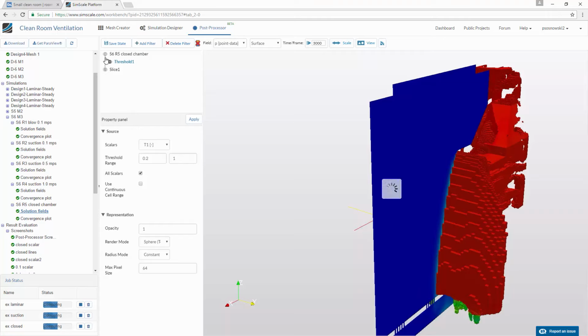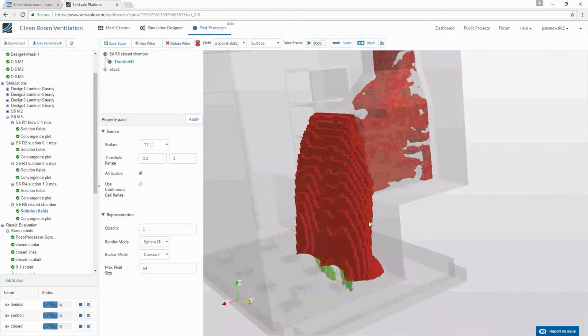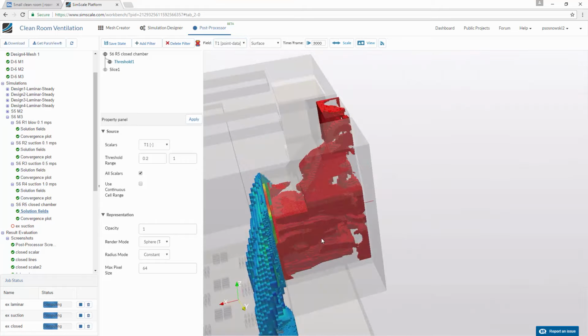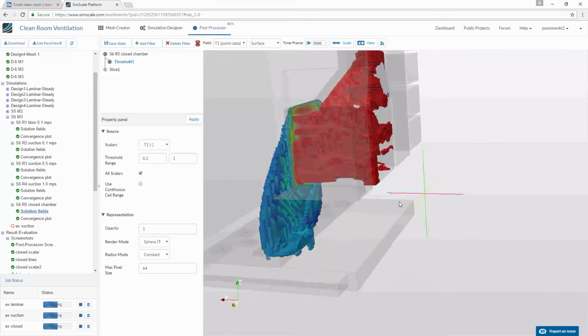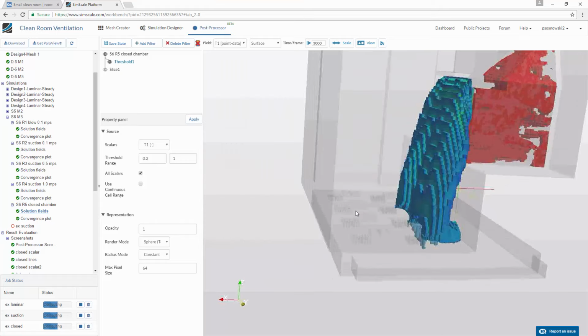Okay, let's do some cleanup of this visualization to see the thing clearly. I'll once again show the underlying geometry of the closed chamber, which will result in showing where we have the contamination going on. So the whole chamber basically is filled with the contaminant, and then there is, I would call it, almost a waterfall of contaminant that is being sucked through the floor and later is being dissolved and still sucked out further away.